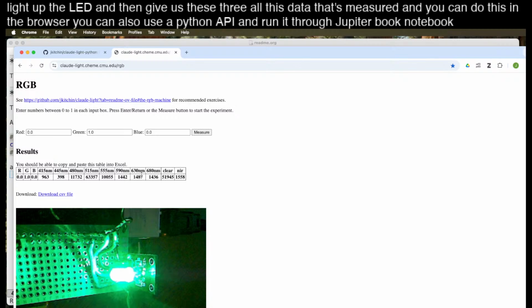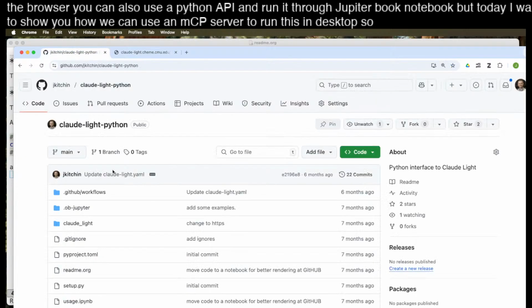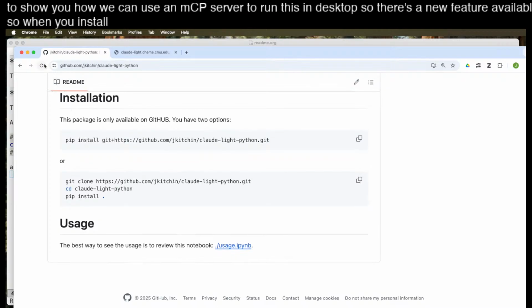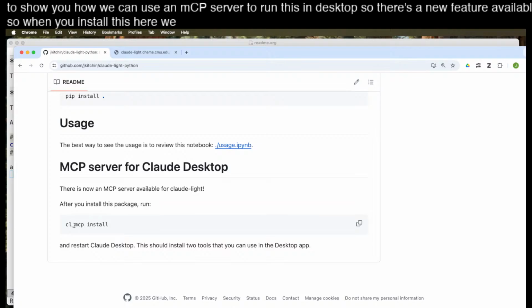But today I want to show you how we can use an MCP server to run this in the Claude Desktop. So there's a new feature available. So when you install this, we can do clmcp. That's a command line tool that gets installed, and install the MCP server.